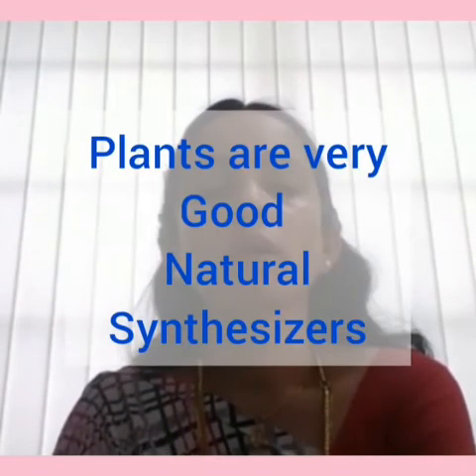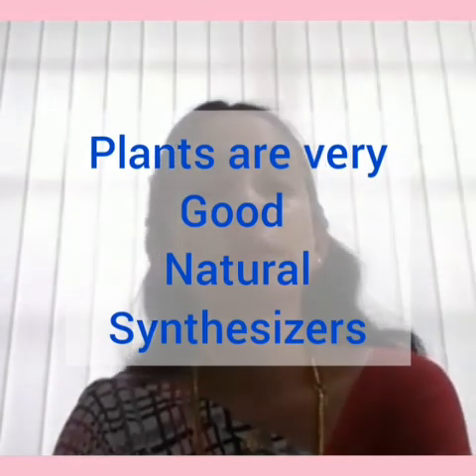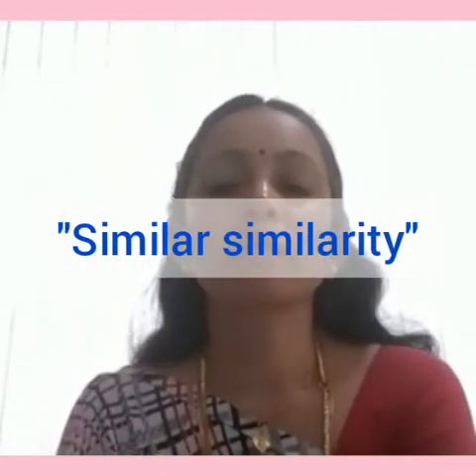Soxhlet extraction is one of the widely used methods for extracting valuable bioactive compounds from various natural sources. Plants are very good natural sources which synthesize organic compounds, and therefore they are referred to as very good organic synthesizers. This process follows the principle of 'like dissolves like,' using solvent reflux and the siphon principle to continuously extract solid matter with pure solvent, which increases extraction efficiency.